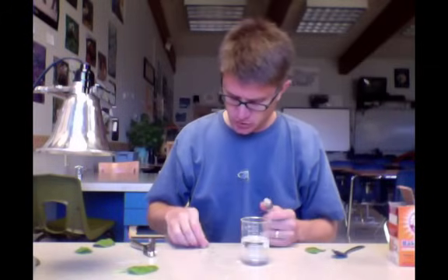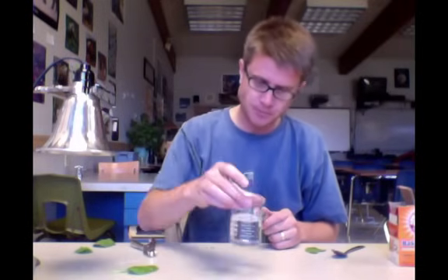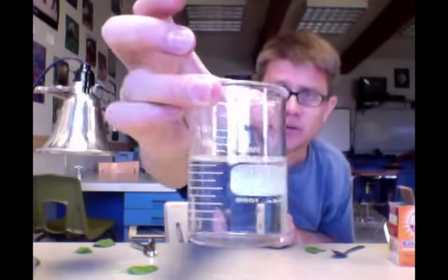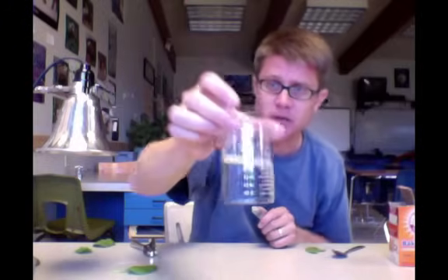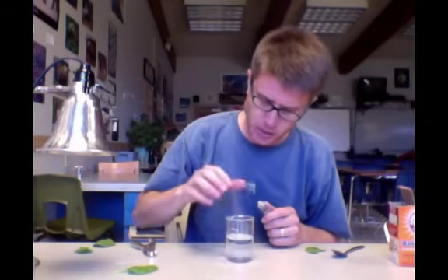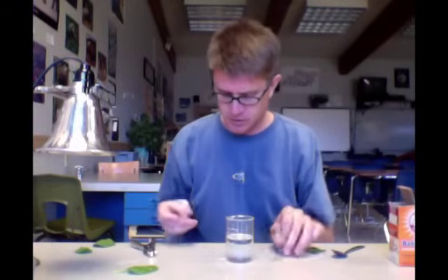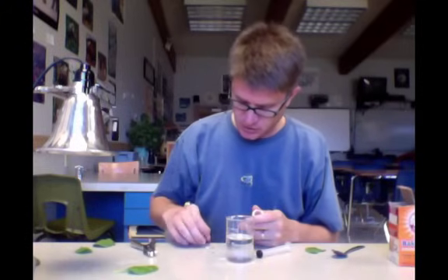Next thing you're going to do, let me show you this. If I were to take one of these leaf chads and throw it in water, it's going to float. So this is our carbon dioxide water. The reason it's going to float is that there are little air pockets within the leaf, and those make it buoyant. What we want to do in this lab to get started is we want to sink the chads.